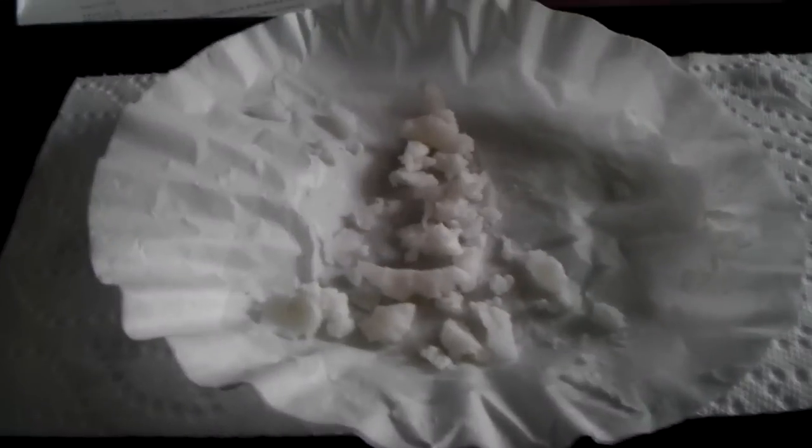You can see there's still a little bit of product in here that won't come out. Here is your final product and you can see the crystals. The powder is a lot cleaner now that we've washed it multiple times and once it's dry you're ready to store it.